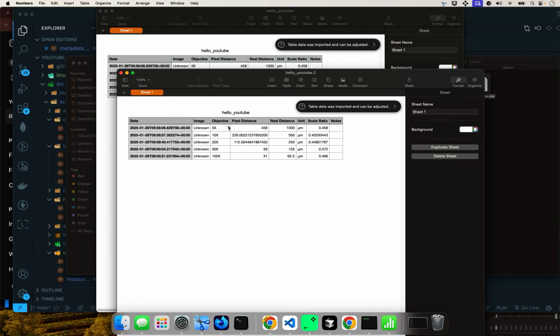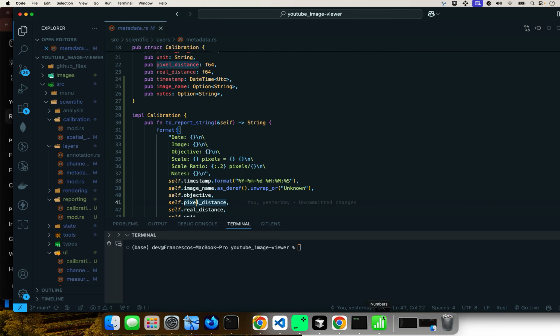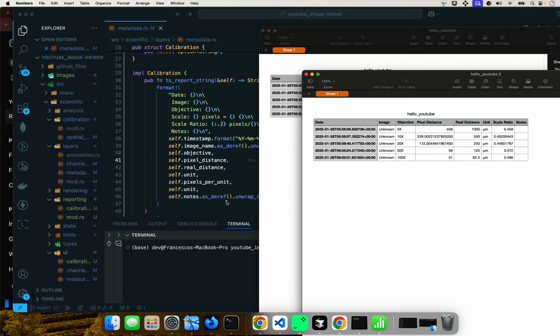Okay, image, objective, and let me just show you. You see here image timestamp, image name. I didn't put in the image name, but you can put it there. Objective, pixel distance, real distance, whatever is in the micrometer, the real distance. This is the screen distance. The unit that you're using, you can change it. You can be using microns. If you're doing microscopy, most of the time you're going to be using microns, but sometimes you will use nanometers if you're doing laser confocal microscopy, or you can be doing millimeters if you're doing stereo microscopy or things like that. This is the scale ratio, the unit, and here notes. It gives you that choice to add there. That's where that is coming from.